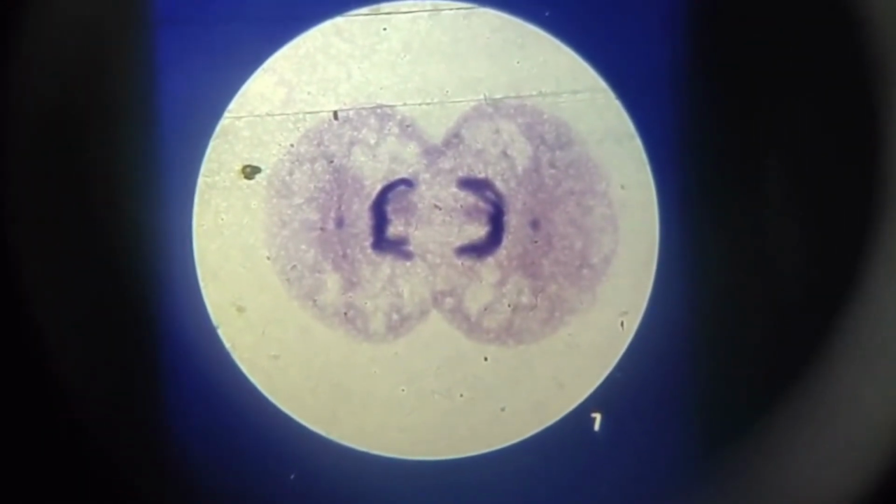Now let's go to the 7th slide. In this slide, you would see the telophase. The two groups of chromosomes have drawn completely apart from each other. At the same time, the rest of the cell is beginning to divide. The cell membrane pinches inward and the cytoplasm is dividing into two masses. If you go back to slide 6 and examine the cell membrane carefully, you will actually see the beginning of this pinching process. As the cell approaches its division into two cells, the individual chromosomes become less distinct.